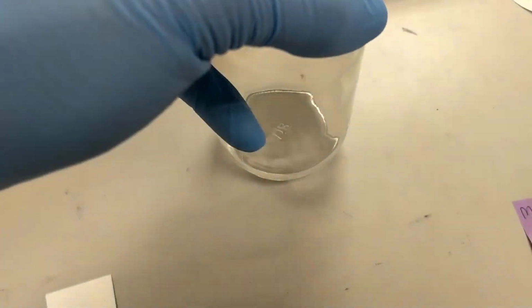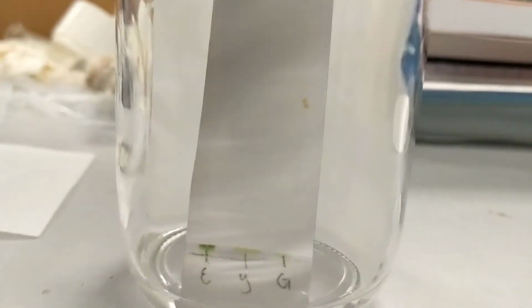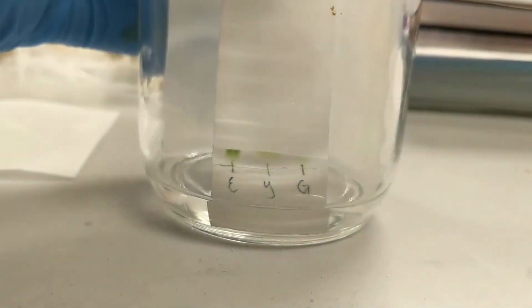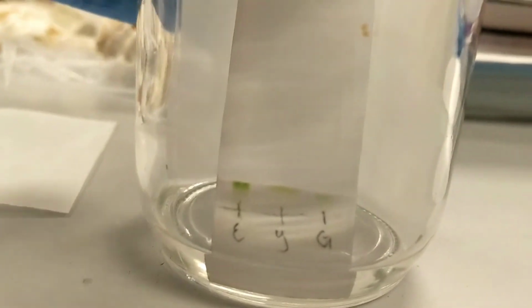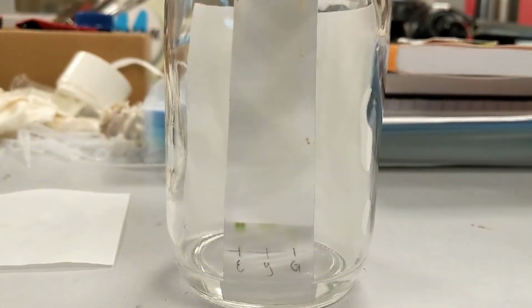and I'm going to put it in this chamber. Alright, this is my plate after I added the extracts. I'm just going to place it inside this chamber and let it run. I'll let you guys watch me put it in. You can see it's just going to pull the hexane acetone mixture up the plate. Oh, you can see. You see how it's moving the bands? Man, it's running pretty fast. I'll let you guys know when it finishes.